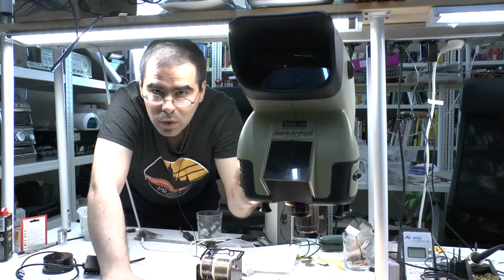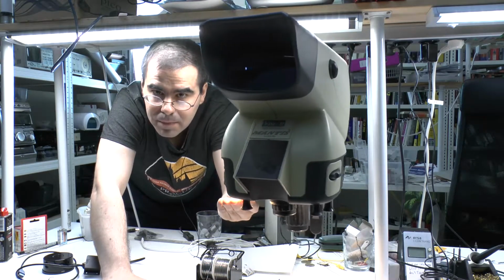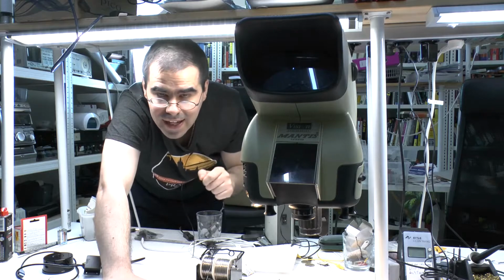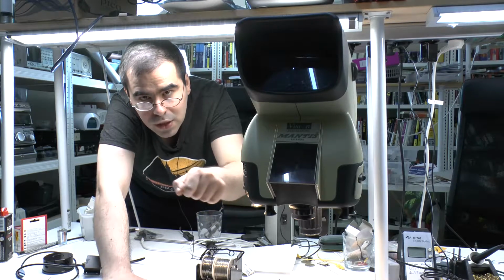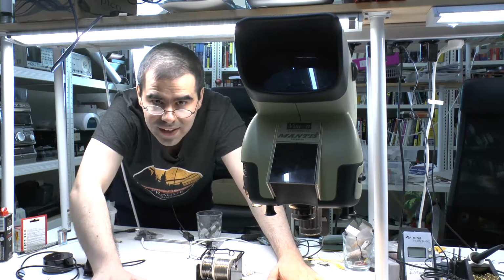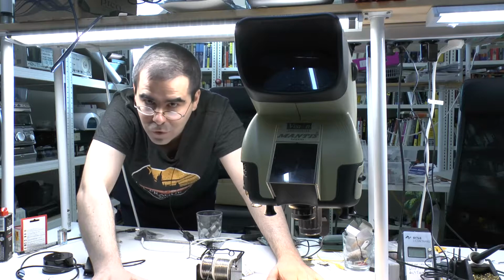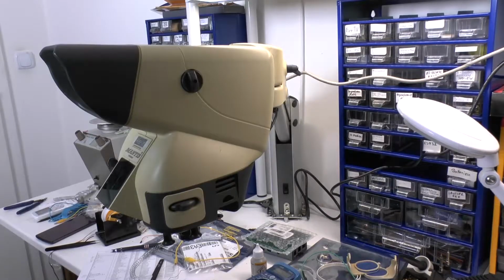Today I found some old footage of me working on this Mantis microscope. In particular, I had a power supply failure late at night and I quickly got it working again. And then I replaced the lamps with light emitting diodes. Why I did this, how I did this, and how the actual troubleshooting process went on, I'm now going to show you. And yes, I was working for 48 hours and I apologize for looking slightly scruffy.